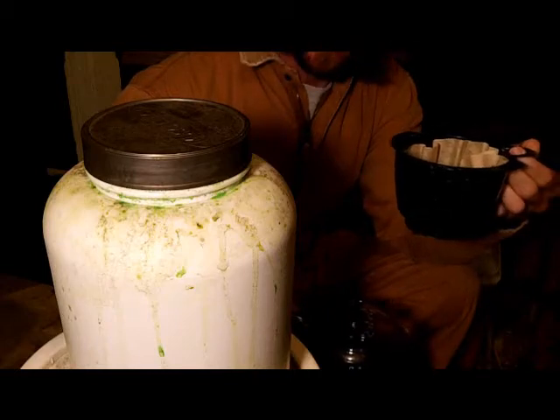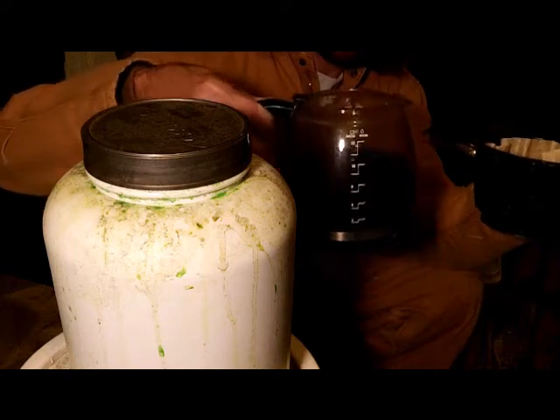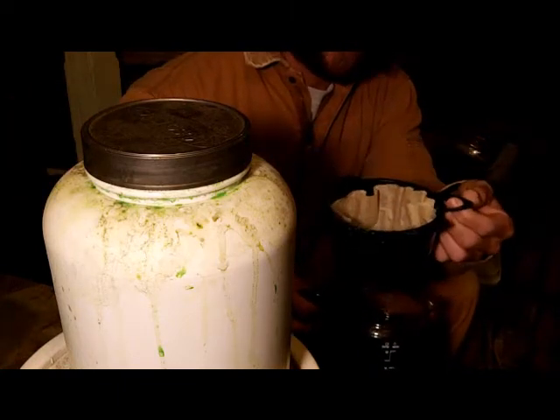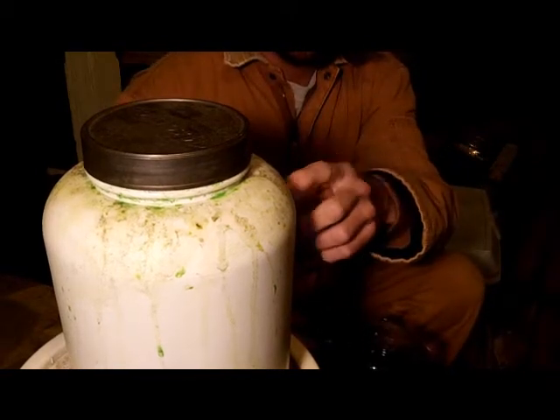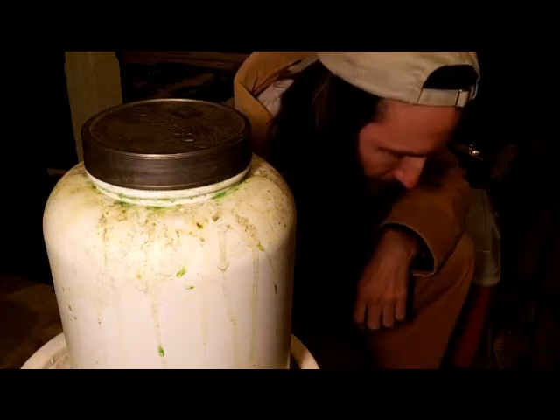I'm quite sure it will ruin it. It's got a heating plate on it. Glass holds up well and you have a little thing to handle your filters. What we're going to do is siphon the fluid out of this tank down through the coffee pot.